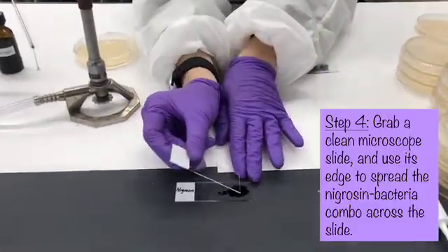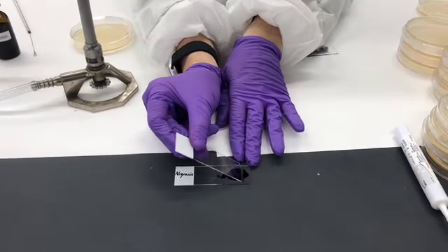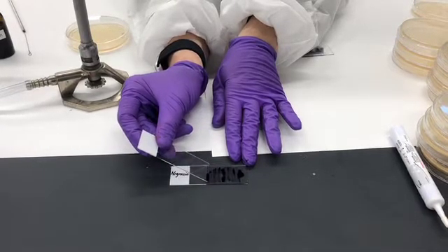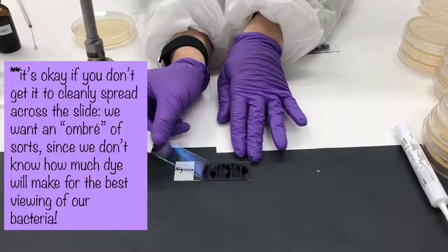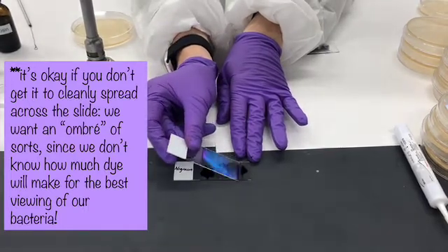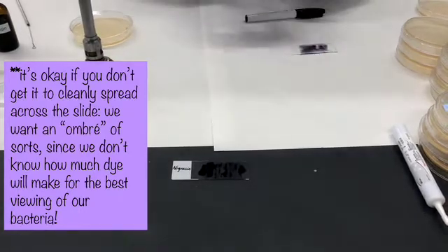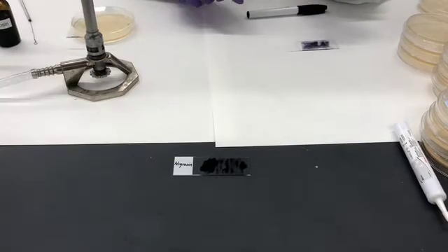We can make use of another microscope slide at a 45-degree angle to gently move the dye across the slide. Our goal is to get different concentrations of the dye — we're not sure yet if it's going to look better to have a really thick concentration or one of these thinner concentrations. So by making this sort of ombre-like mixture across the slide, we'll have lots of different options when we observe the microorganisms under the microscope.